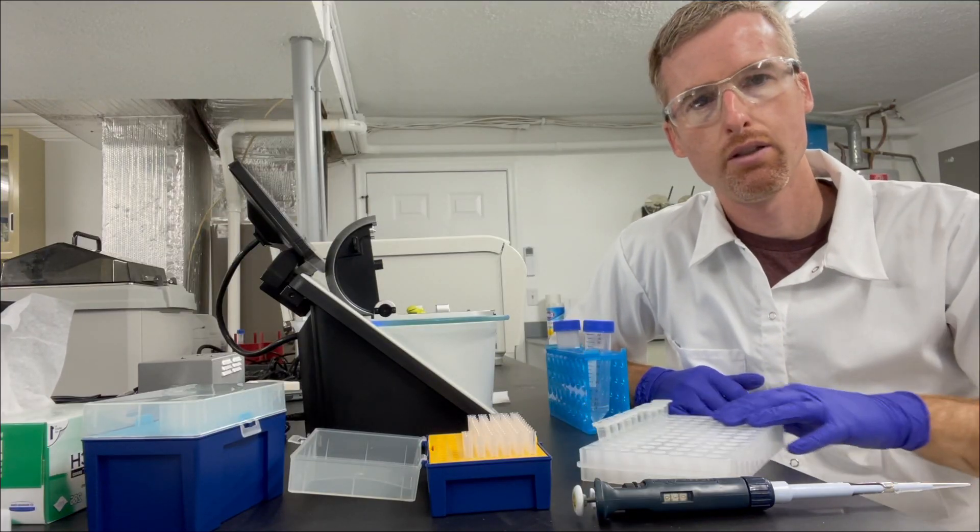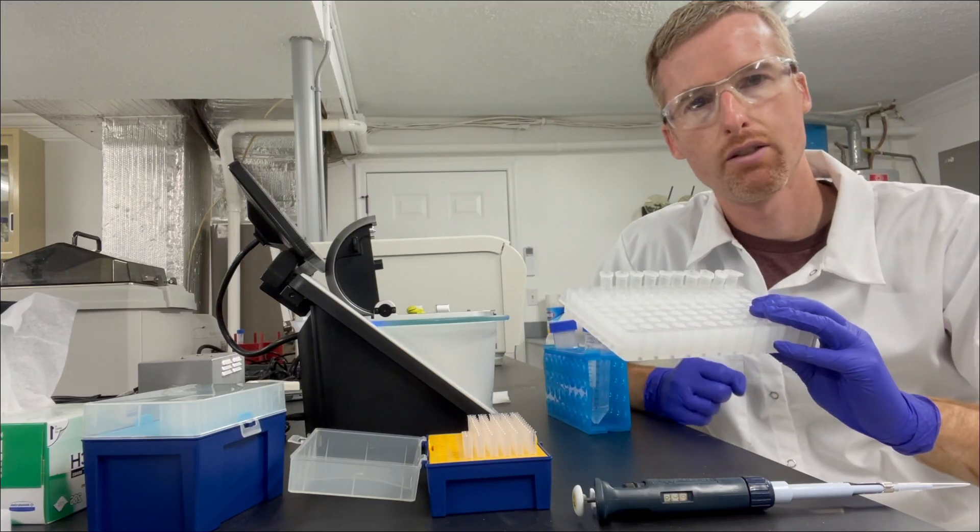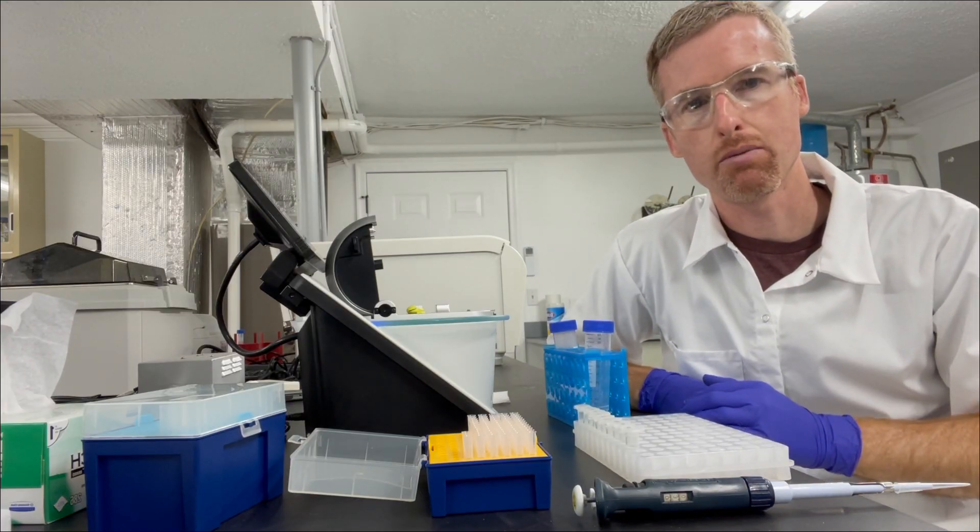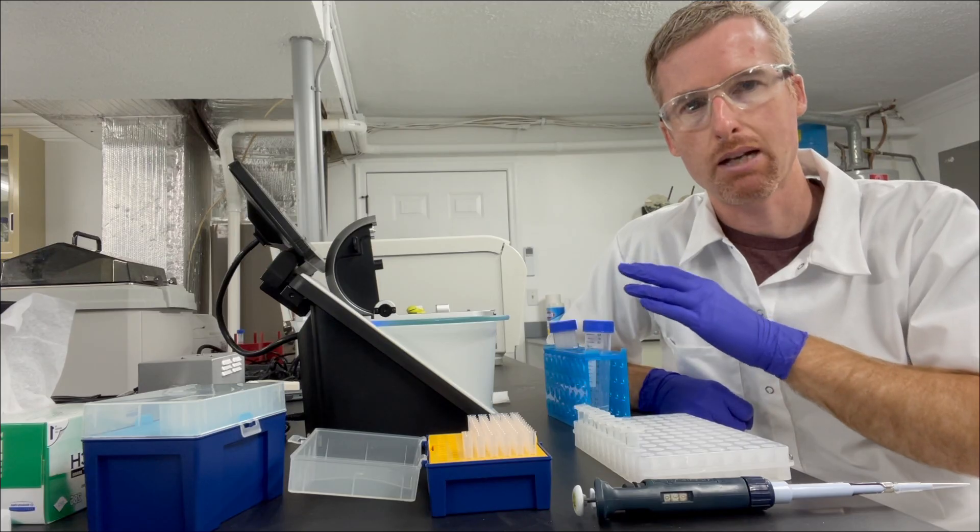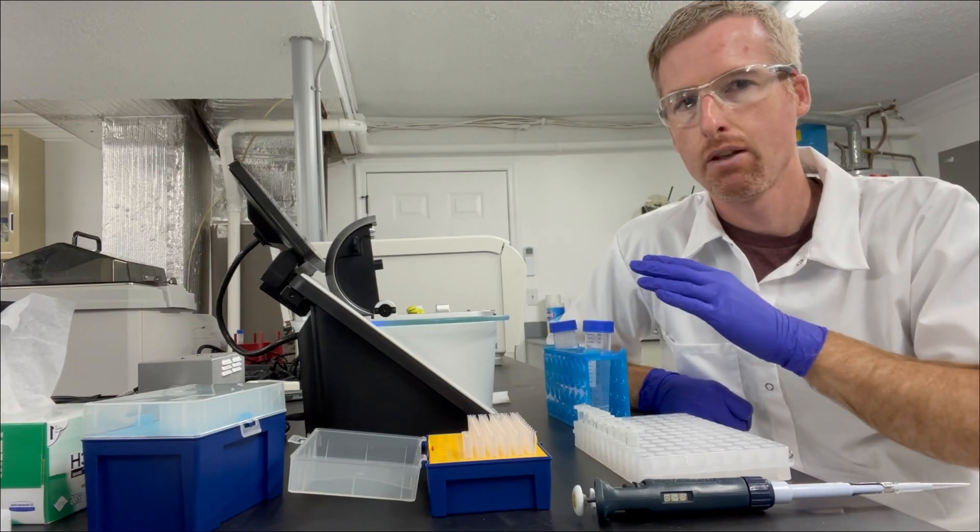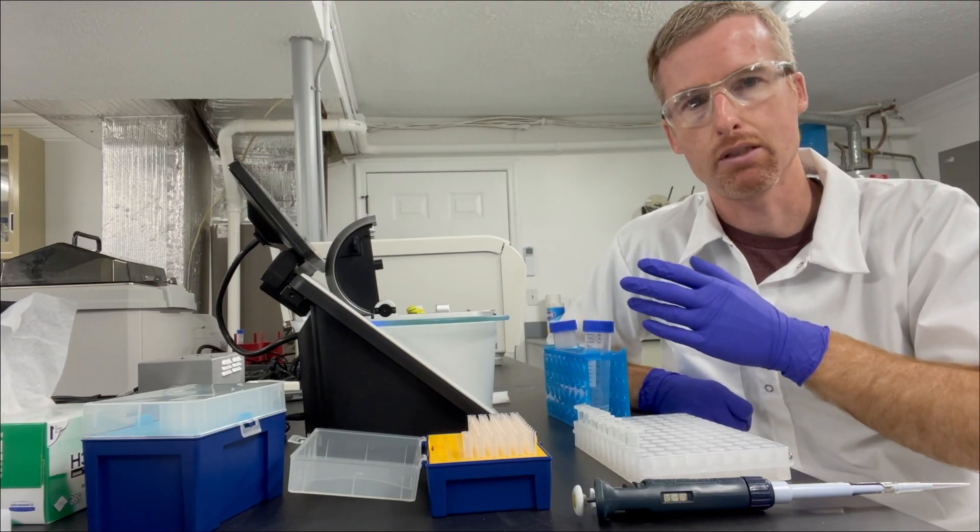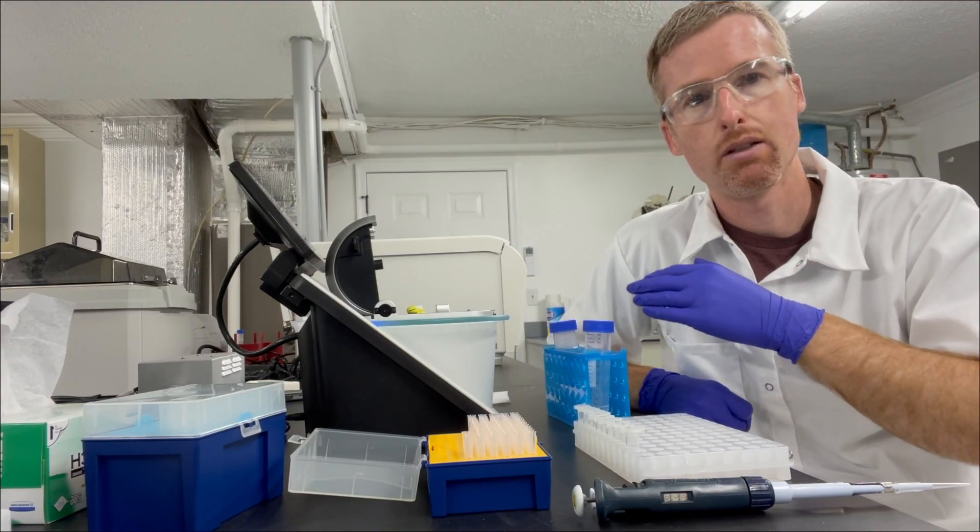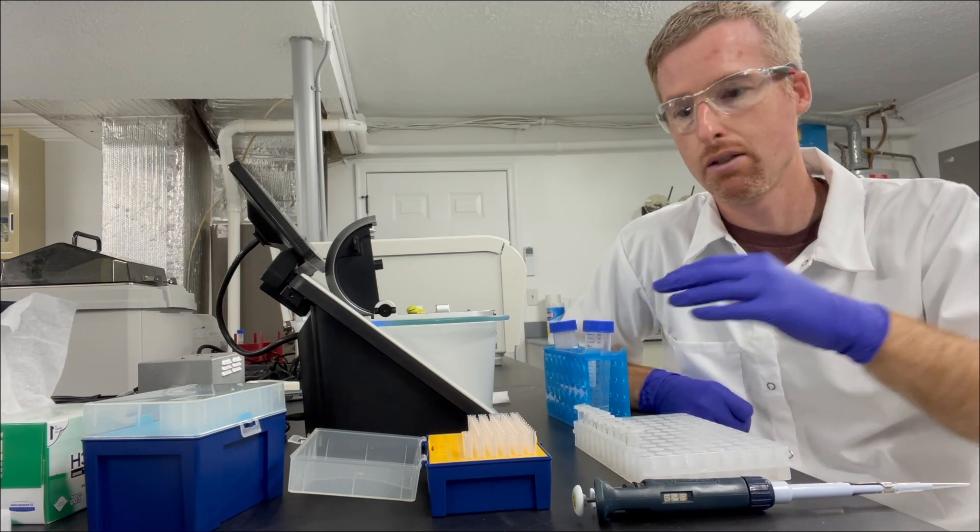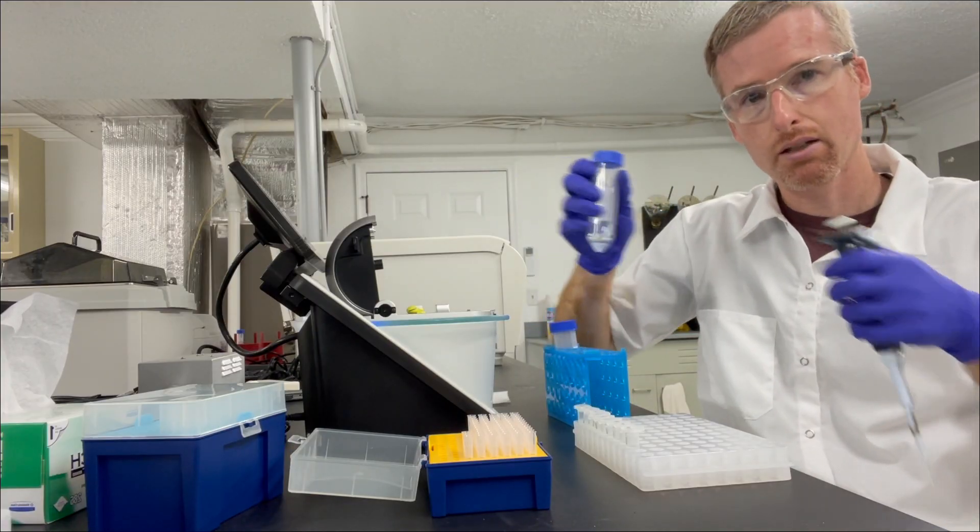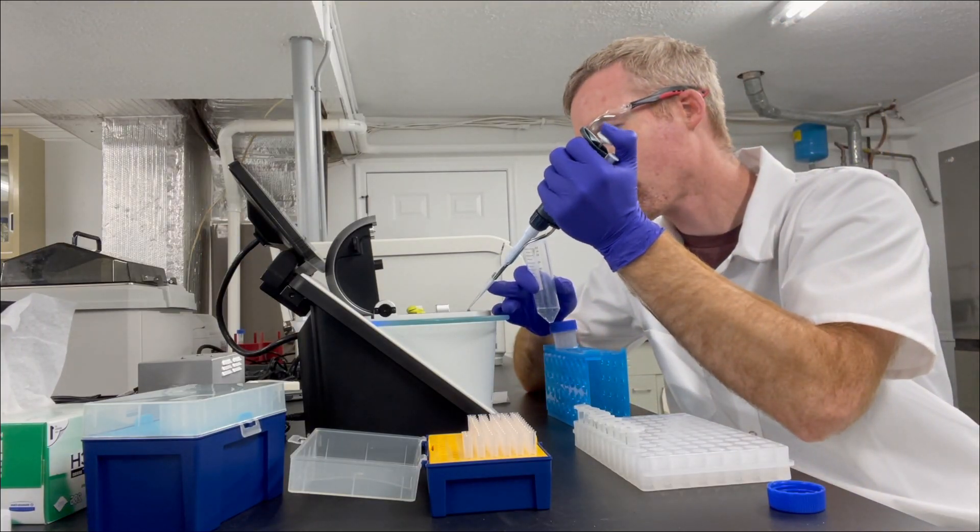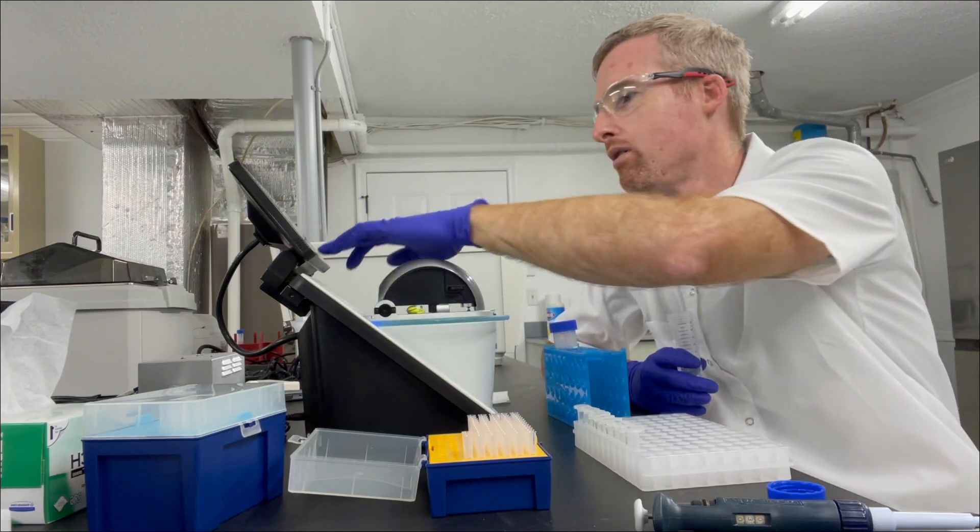Okay, so I eluted 10 one milliliter fractions from my 1 ml of nickel agarose, and now I'm going to measure the protein concentration in them using the nanodrop spectrophotometer. Now this is a great instrument because it only uses a couple microliters of sample, and because it can read high absorbances. And that's important because we're going to have a lot of absorbance coming from the nickel agarose elution buffer because it has 250 millimolar imidazole. So I'm going to go ahead and blank with some of that elution buffer with 250 millimolar imidazole.